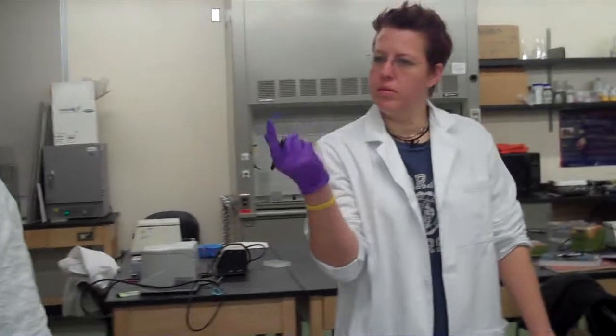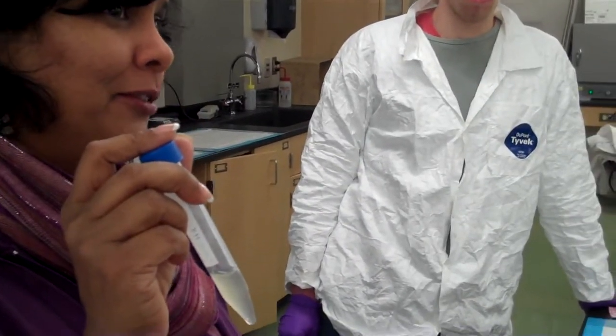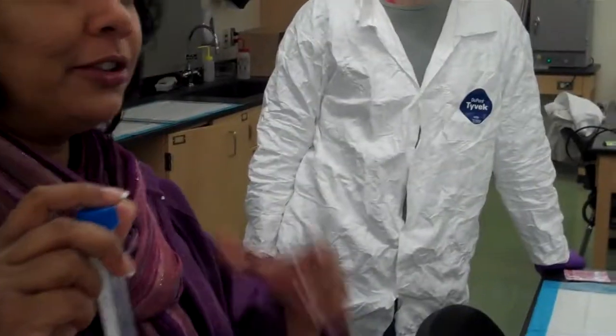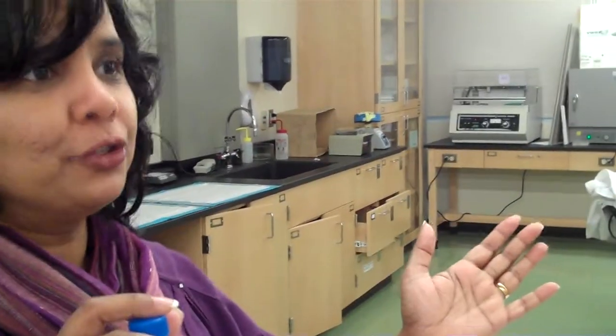So you do it in one part, and then, okay, elaborate. I think you're on the right track. Are you doing it twice? Like, you're just doing an extraction, and then... Okay, so you take out 1.5 milliliters, spin it, and the cells come to the bottom. Yes, exactly. So you take out 1.5 milliliters, put it into the Eppendorf tube, spin it, the cells will settle to the bottom. Then you're going to take off the supernatant, which is the broth, which we don't want, add the next 1.5 milliliters, and then spin it again. Does that make sense?